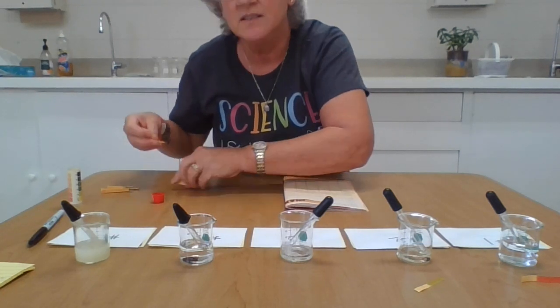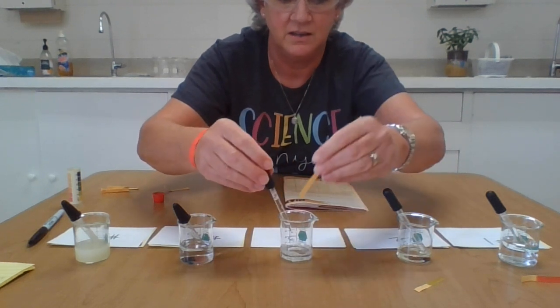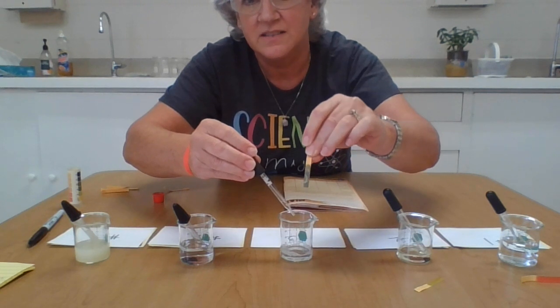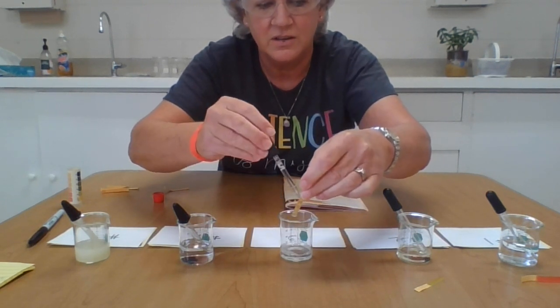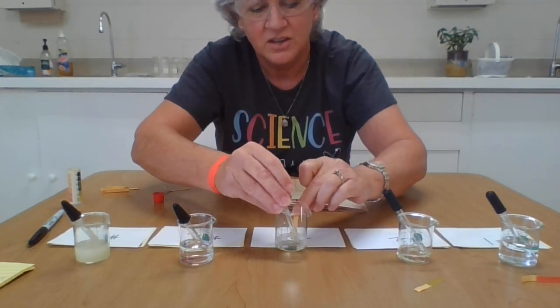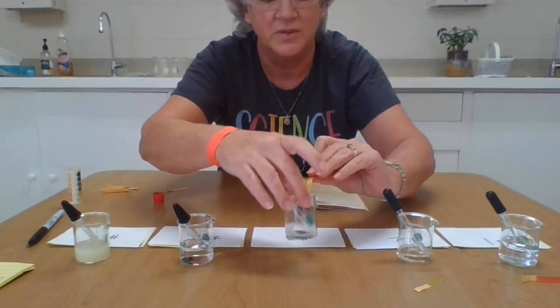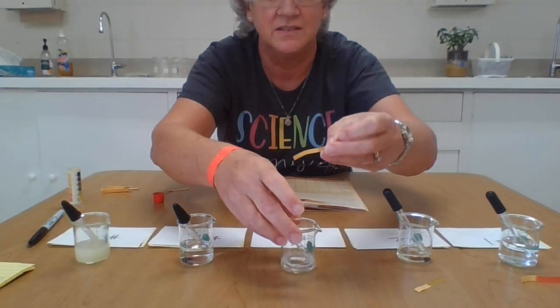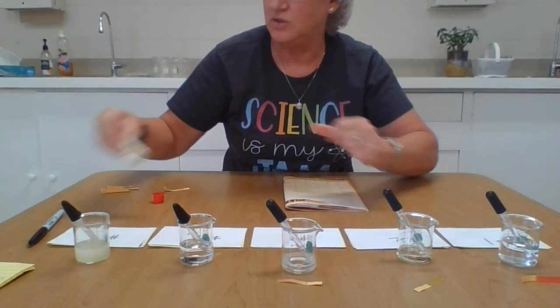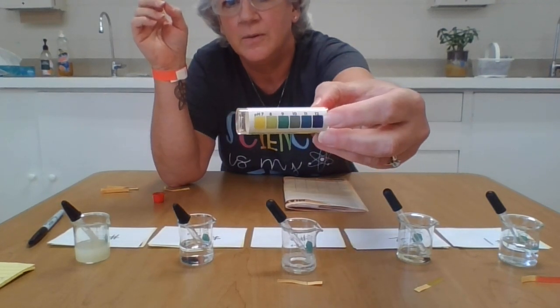All right, the next substance is the bubbly one. All right, I'm going to drop. Oh my goodness, can you see that immediate change that is happening right there? It turned immediately. It turned dark blue and then it went away. So we're going to go with that dark blue. These might be a little bit old, these testing papers. I'll let that sit in case it does change. But it went immediately to this number 12 color on my scale.